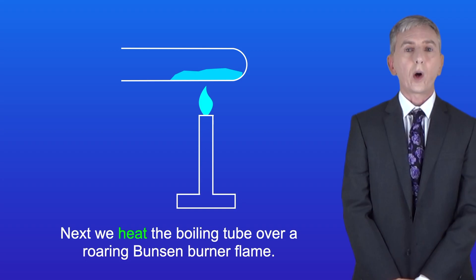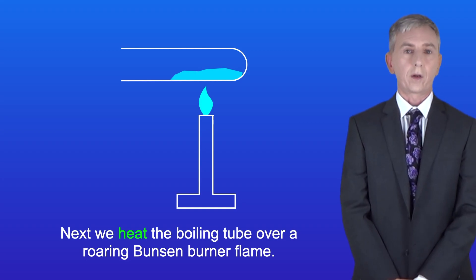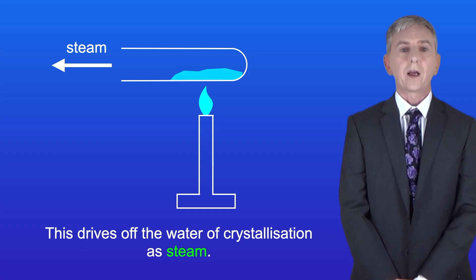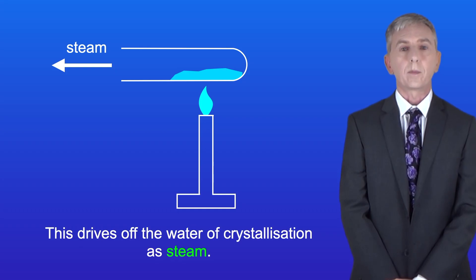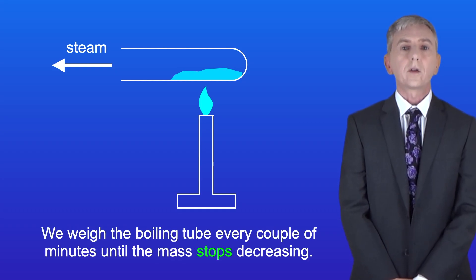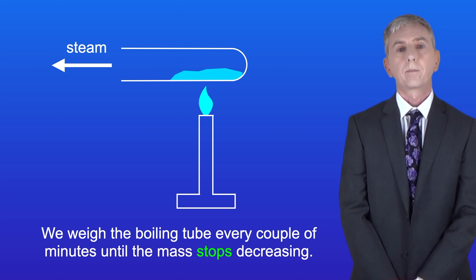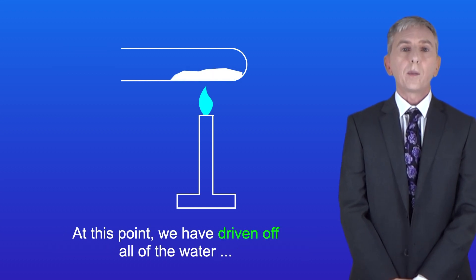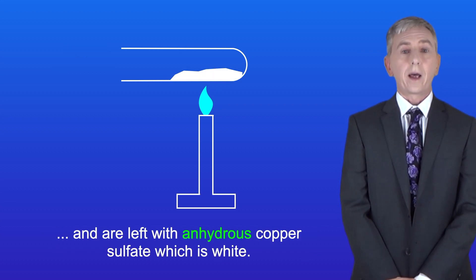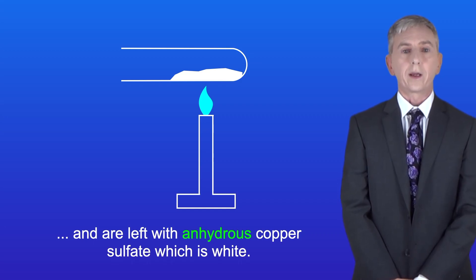Next we heat the boiling tube over a roaring Bunsen burner flame. This drives off the water of crystallization as steam. We weigh the boiling tube every couple of minutes until the mass stops decreasing. At this point we've driven off all of the water and we're left with anhydrous copper sulfate, which is white.